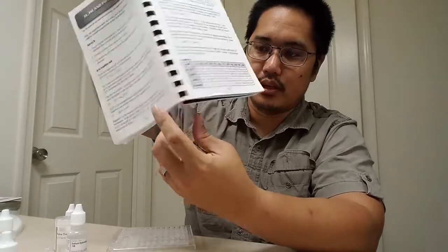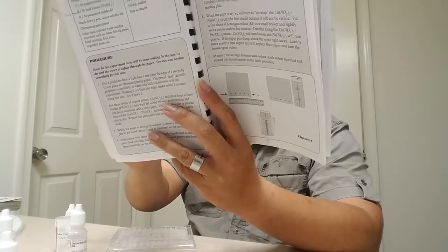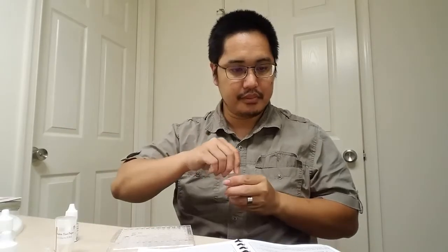My concentrations of NaOH must be at 10 to the negative 2 in column 12, and for a pH to be 12, you need to put 1 drop from a mini pipette of the sodium hydroxide into the water in each well of this column to reduce the concentration to 10 to the negative 2.